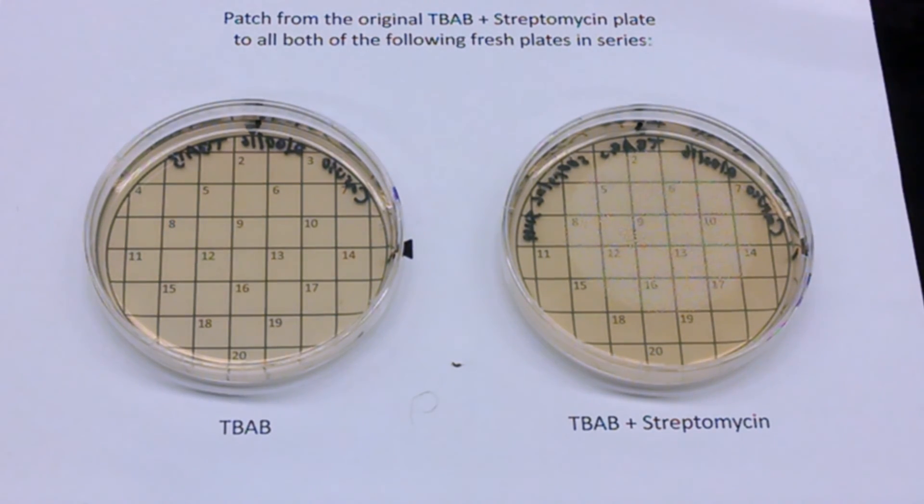And you'll have that information. When you're done, always keep the selective plate because that's the one you're going to want to do PCR on in the strep lab. All right. That's it. Very easy. Good luck in your experiment and have fun.